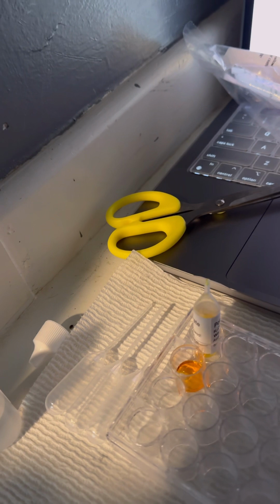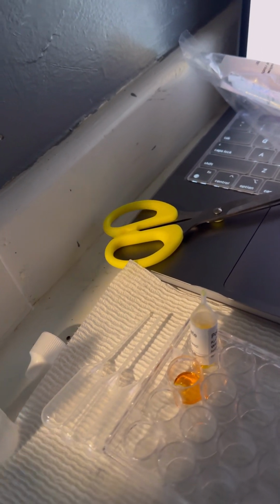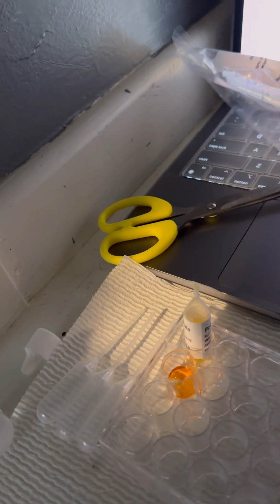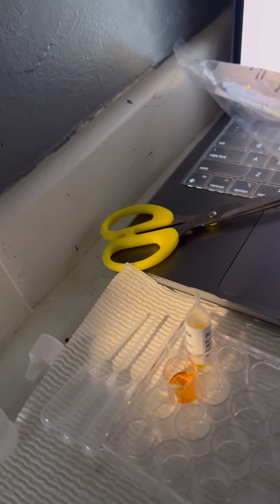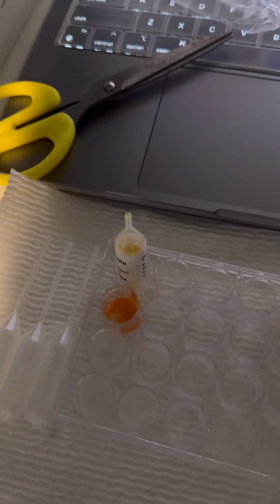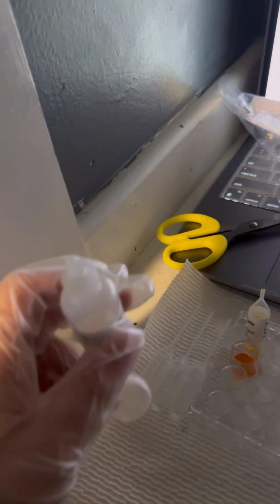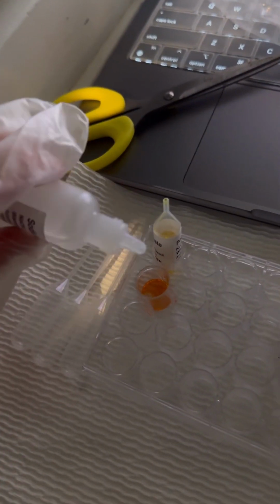And then it says to record the number of drops of sodium hydroxide added and the resulting color change in data table 1. So we'll do that. After adding hydrochloric acid, this is the color change, a bright orange. And now we'll add drops of sodium hydroxide and see what color it makes, the complete color change.